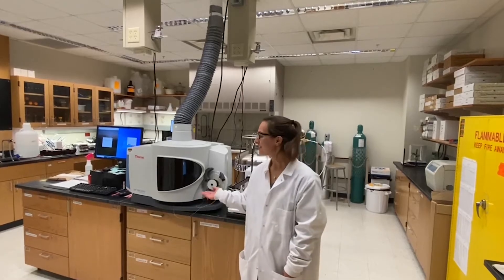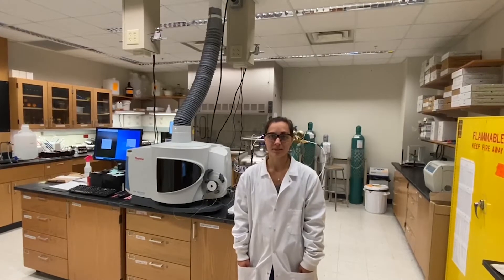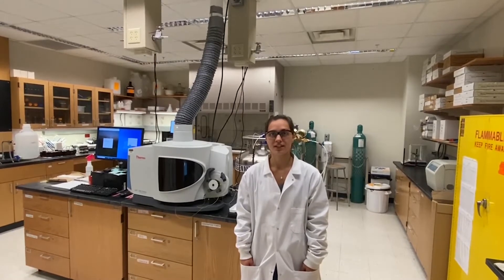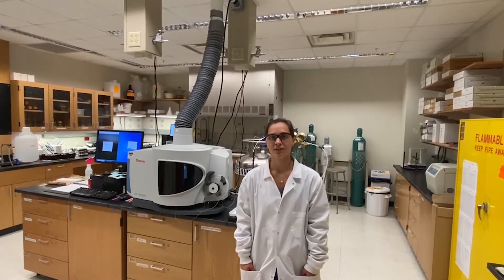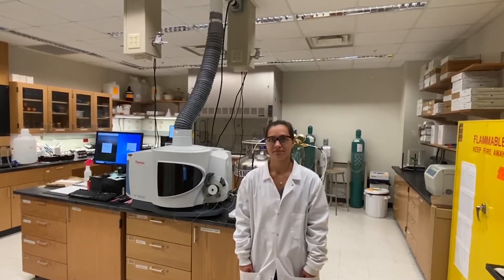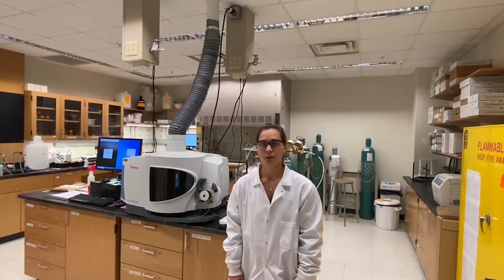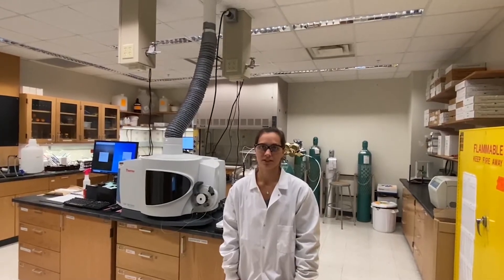This instrument here is an ICP, which stands for inductively coupled plasma, and it is used to measure elemental composition on a sample of interest by comparison to solutions of known concentration as standards. We also use AAS, or atomic absorption spectroscopy, which is a different instrument that can also tell element-specific compositions.